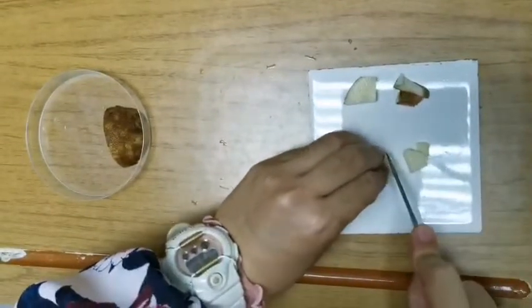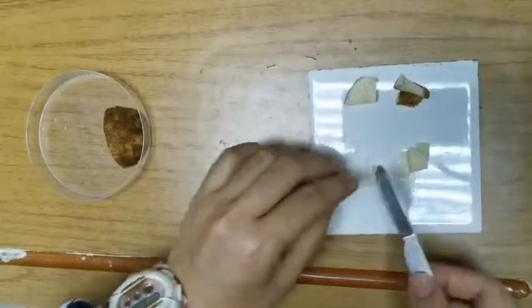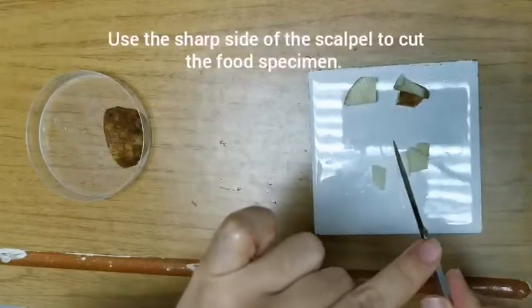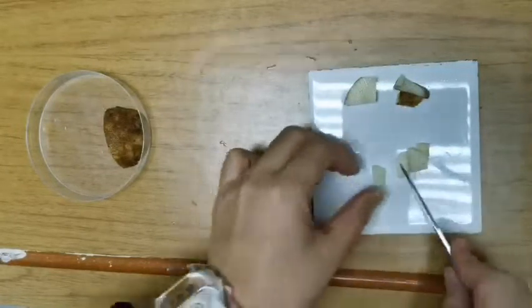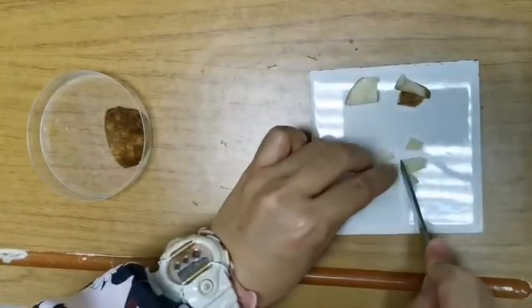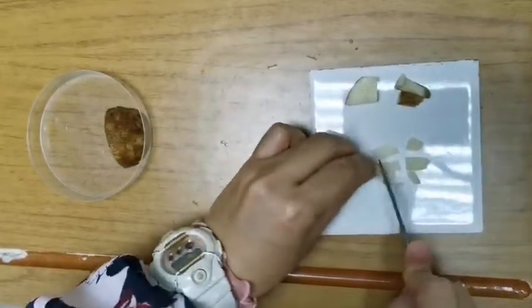The scalpel blade is very sharp, so make sure that you don't cut yourself. You'll notice here some students don't know that there is a blunt end and a sharp end to the scalpel, so you use the sharp blade to cut. Cut it into small pieces.